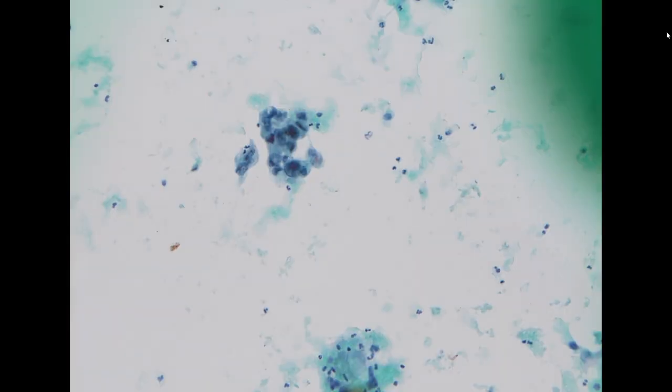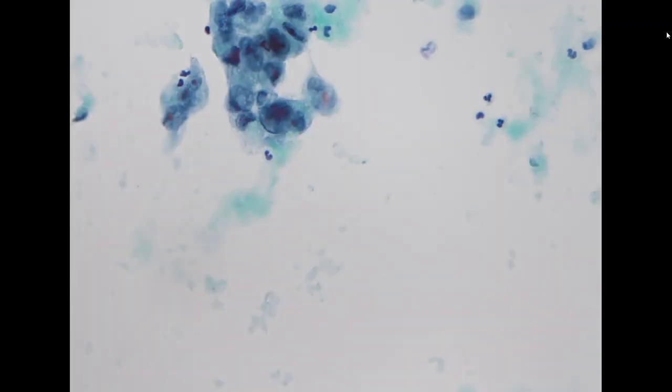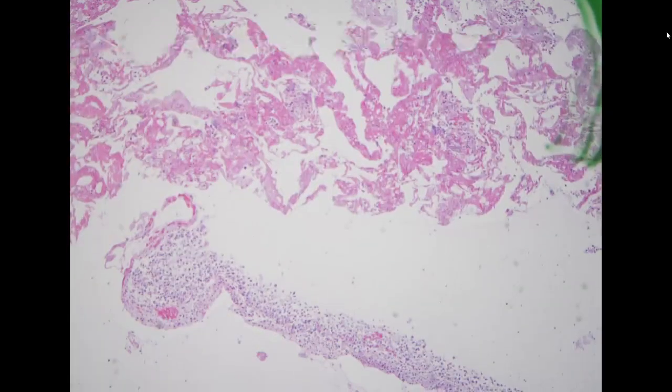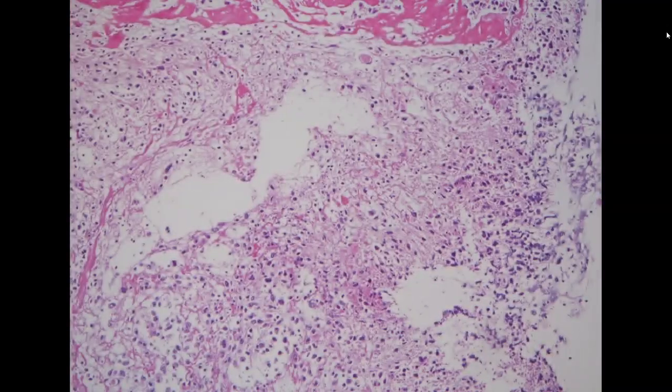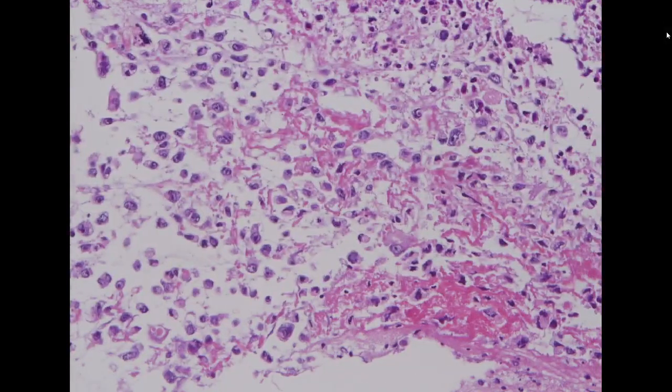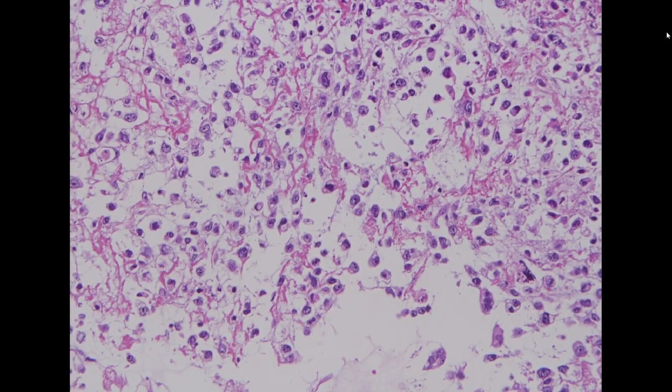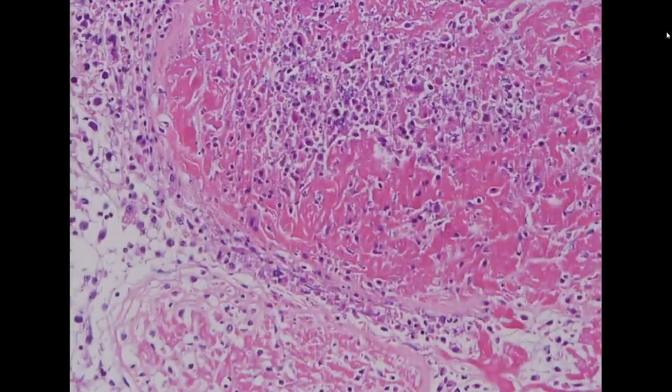But the patient actually had a prior history of undifferentiated pleomorphic sarcoma on the pleural surface. So this is a malignant specimen. We are uncertain if it is a carcinoma or just a high-grade malignancy, so we will call this positive for malignancy. And here you can see some single cells in the cell block, admixed with inflammatory debris and fibrin. Some of them show spindling, like a sarcomatous feature. So we would just call these positive for malignancy.